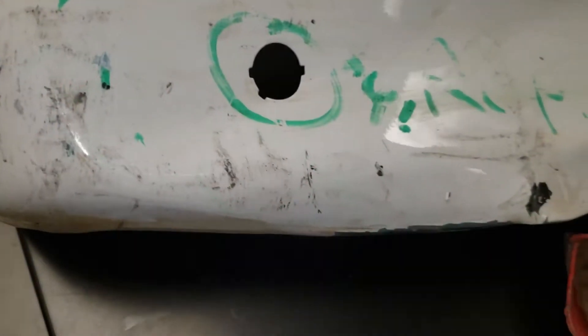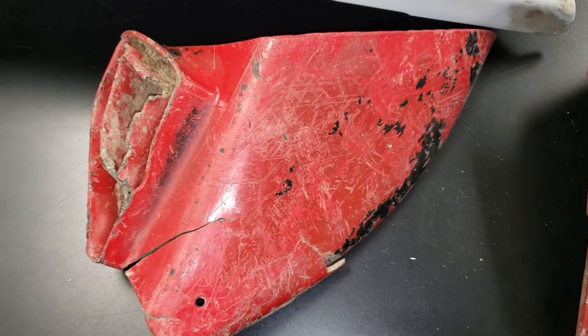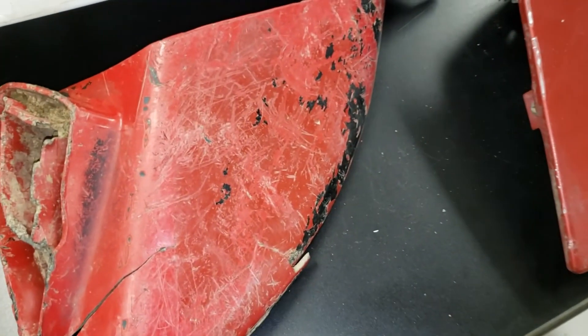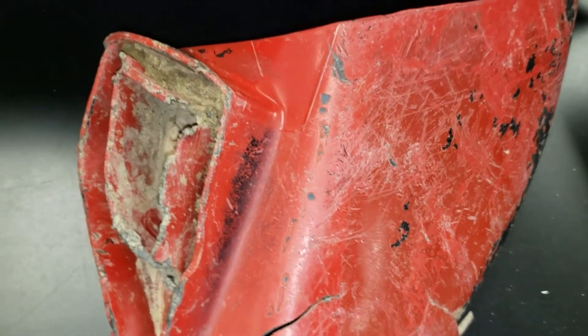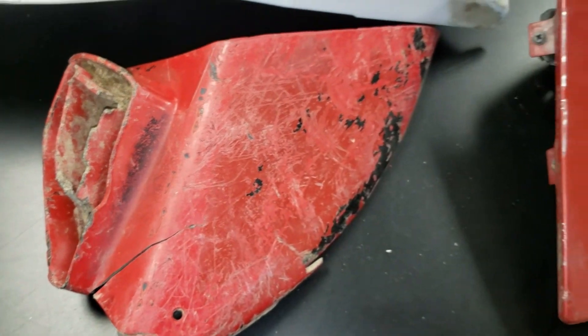There were also two other red body parts that were used in the paint chip analysis comparison. These are the source items, so take a look at these. I did not ask you to describe these on your activity sheet, but I did want you to see them, because these provide quite an interesting discovery, as you will see.